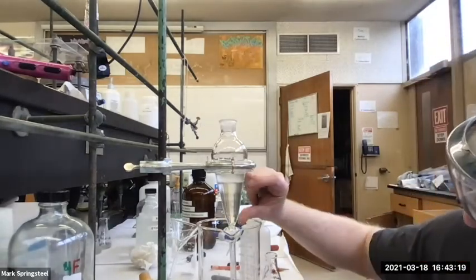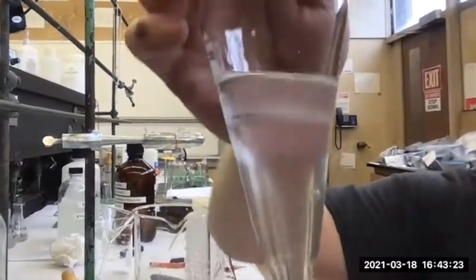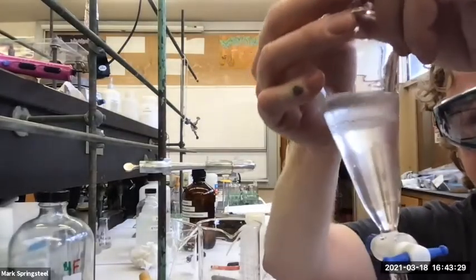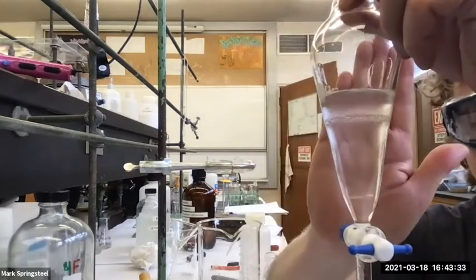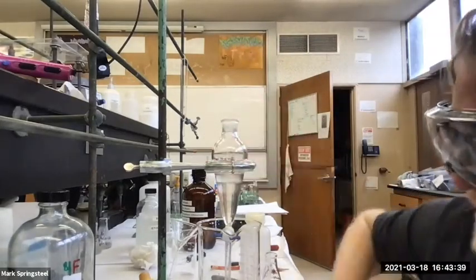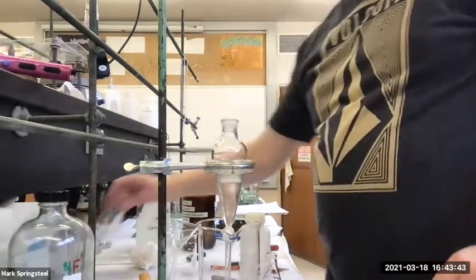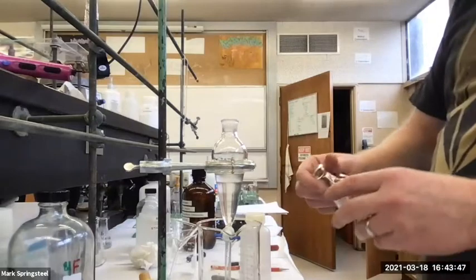And it looks to me, I don't know if you can tell, that the organic layer got clearer. Does it seem a little more clear than before? I'll try to screenshot it for the report. It might look a little bit more clear. It's kind of hard to tell on the video, at least for me. Okay, and so now I'm going to put this organic layer into an Erlenmeyer again.